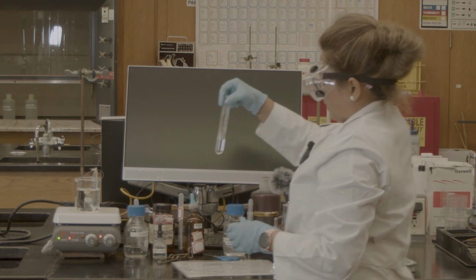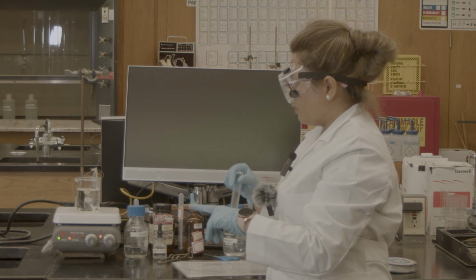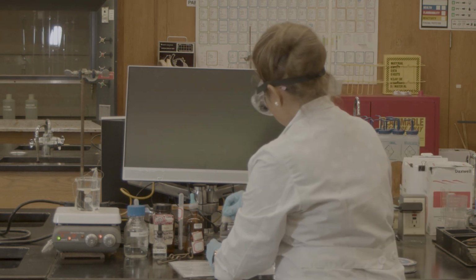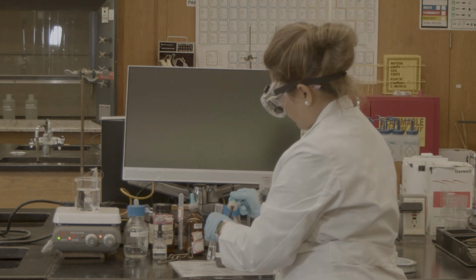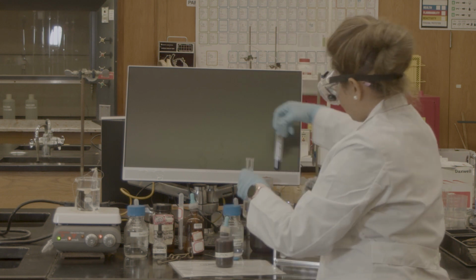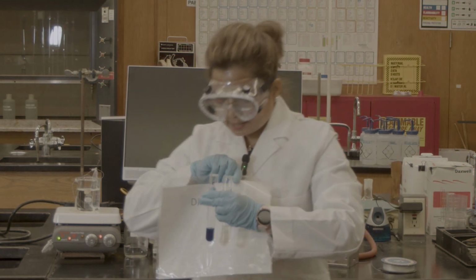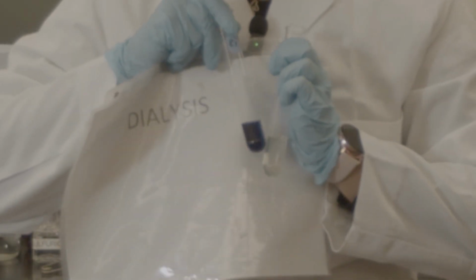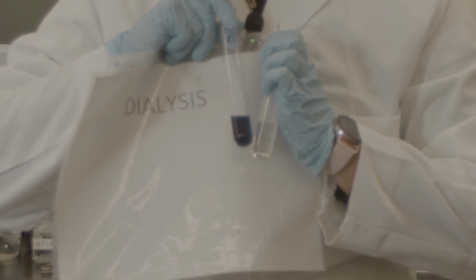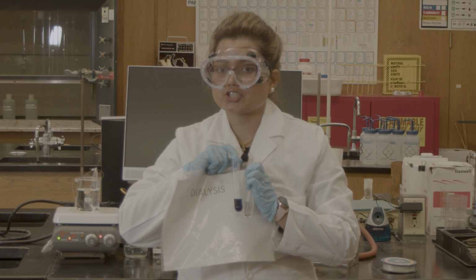Now I'm going to check for the starch. I'm expecting that this semi-permeable membrane will not allow the starch to come outside. So I'm going to use my iodine solution to check whether I have starch or not. I expected blue. I expected blue, but the result that came out is kind of clear. As we have iodine, it is partially yellow, but I expected blue, so it's a huge difference. So my starch did not come outside.